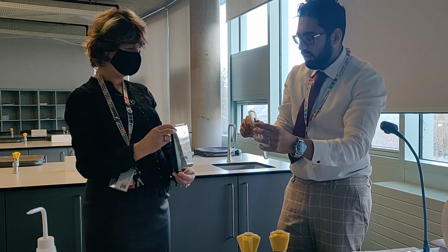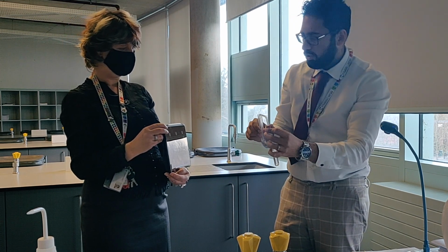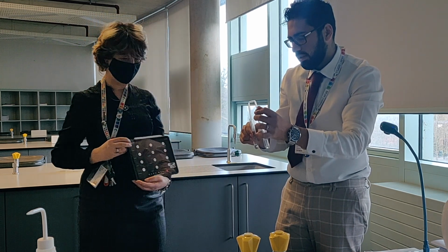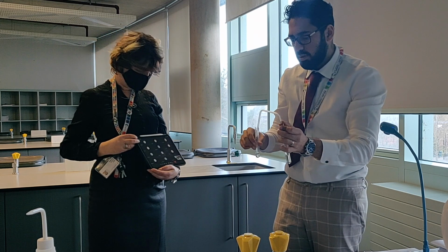Okay, that was test 5. You guys should know this test anyway, like I said, from GCSE. So we're going to move on to test 6. Just give us 2 seconds again to set up.